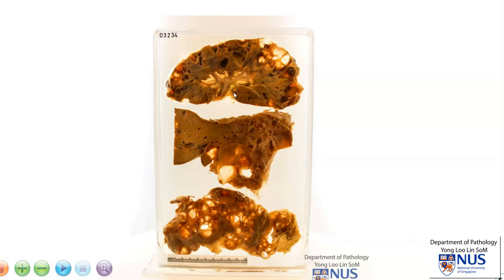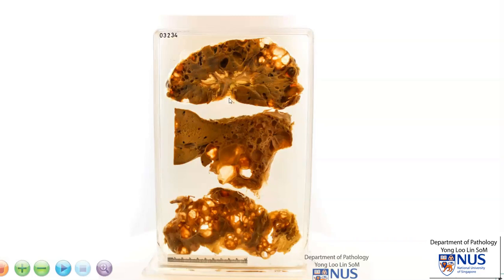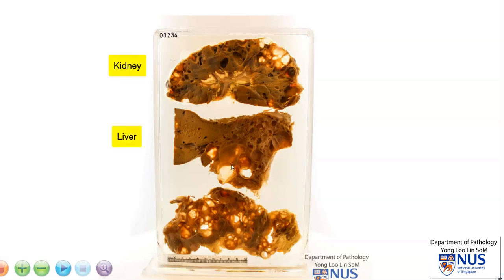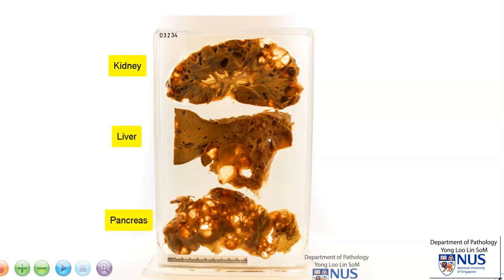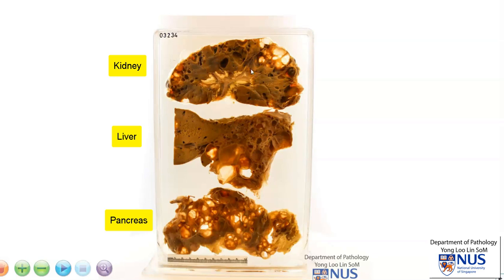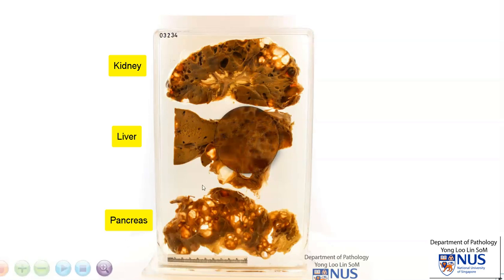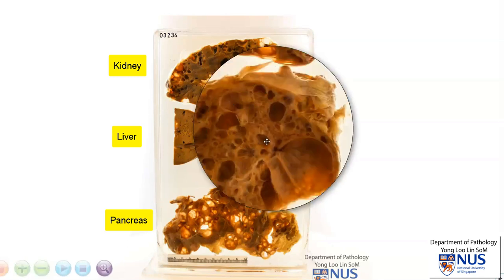Hello. This is a specimen that shows multiple organs. We're looking at the kidney, the liver, and the pancreas. We can appreciate grossly that they are all involved by the same gross pathological process, and that is the presence of numerous thin-walled cysts.